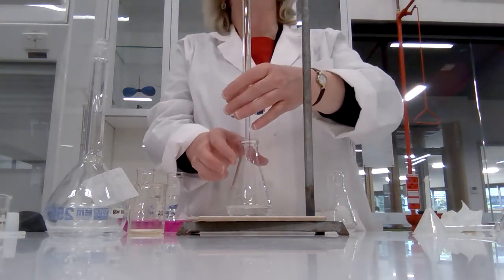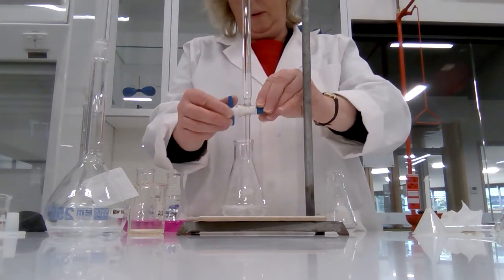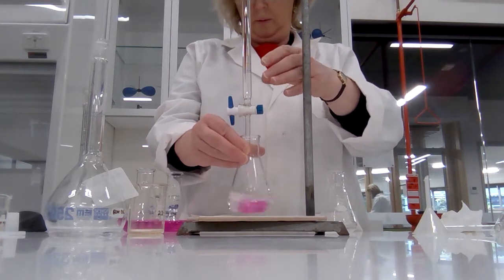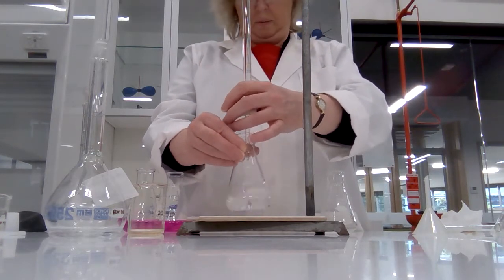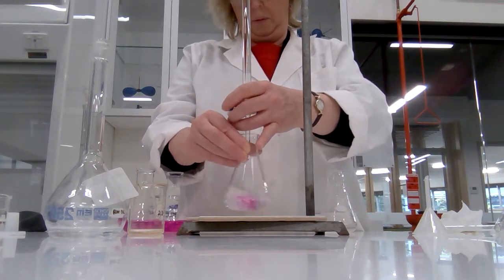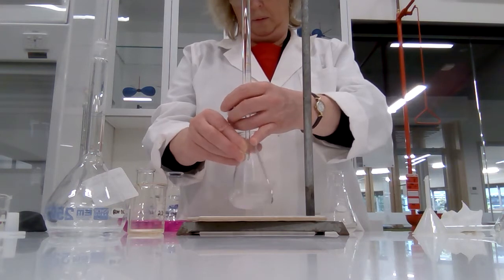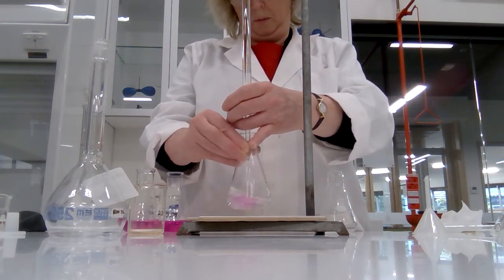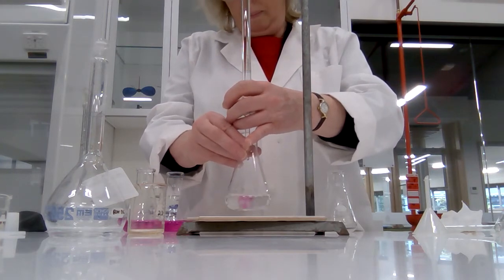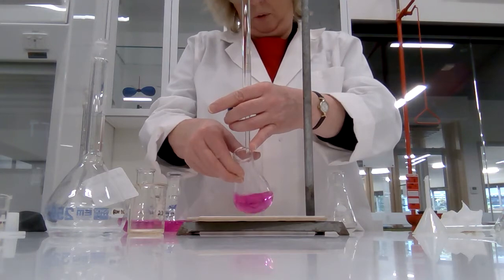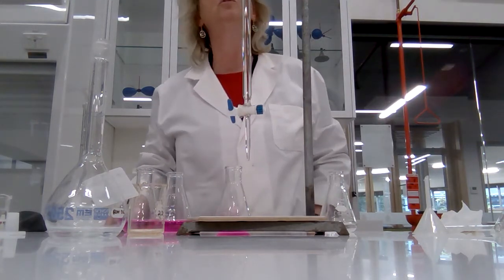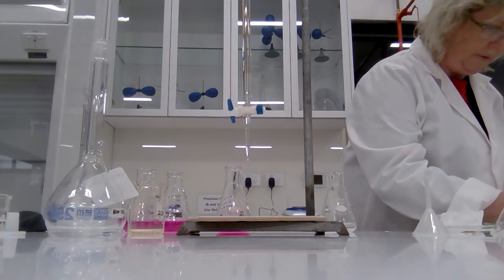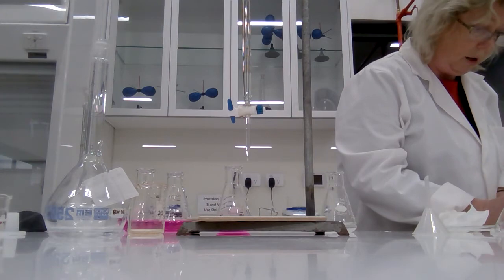Okay. We're starting a third titration at 2.20. Let's see if I can add a drop. There it goes. Lovely. Went down to 16.85. 16.85 gives us a volume, oh dear, of 14.65. That's actually very close to our previous one.